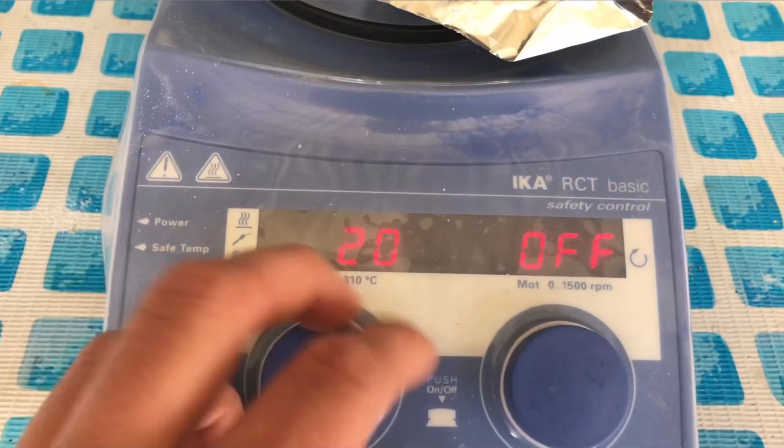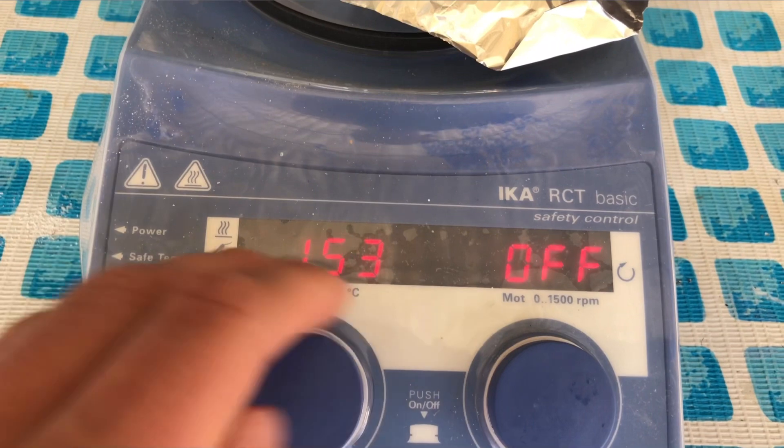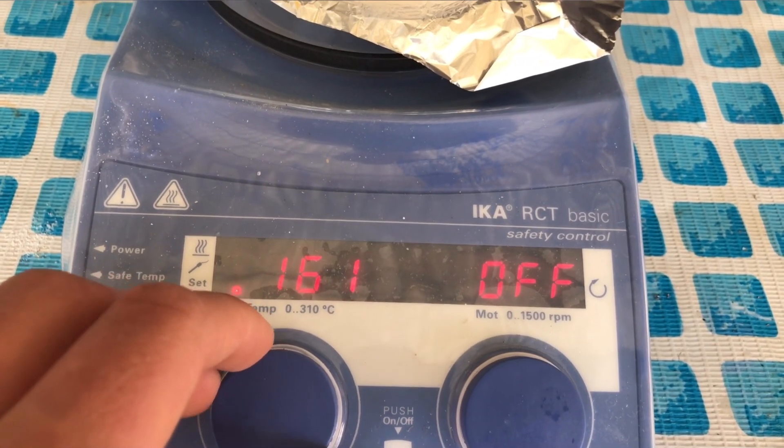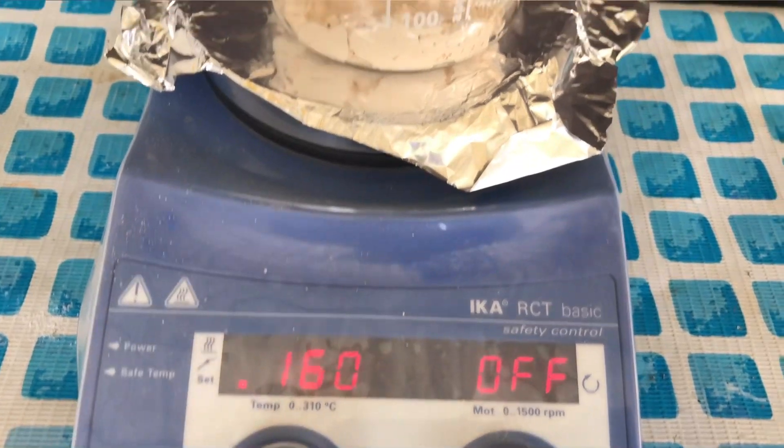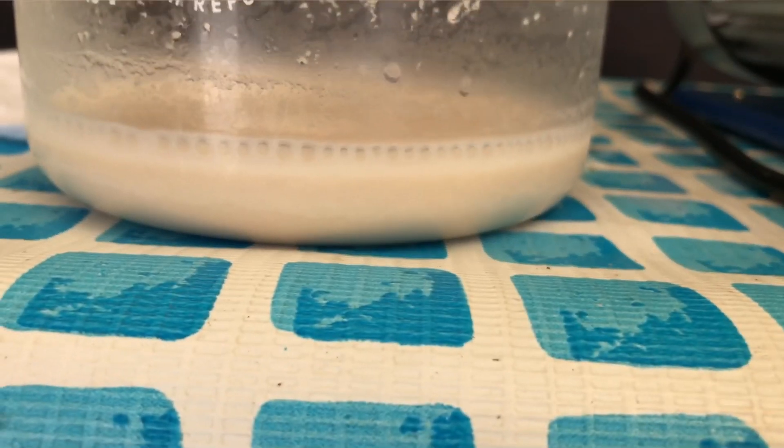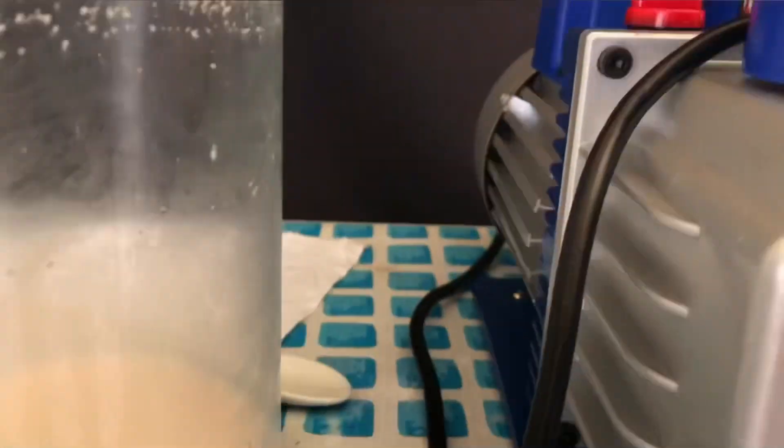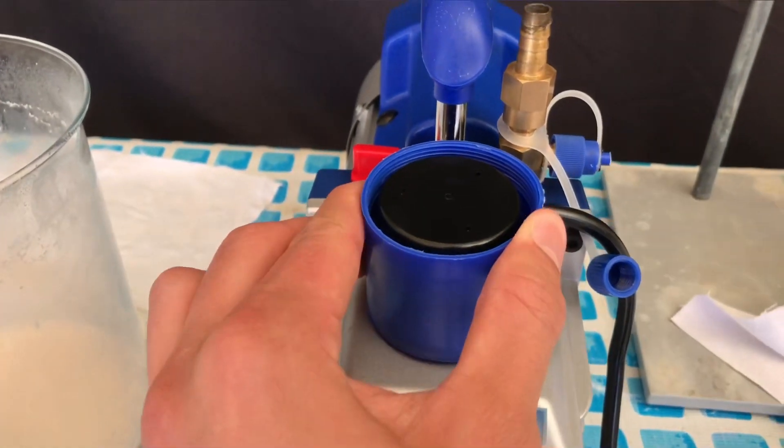Well, why didn't I filter all of it? Is it because it took so long? No. Actually, I would have filtered all of it, but the oil filter of my vacuum pump decided to explode while I was doing the filtration and I first need to repair it. All of this calcium peroxide is going to go to waste and here's the broken oil filter.